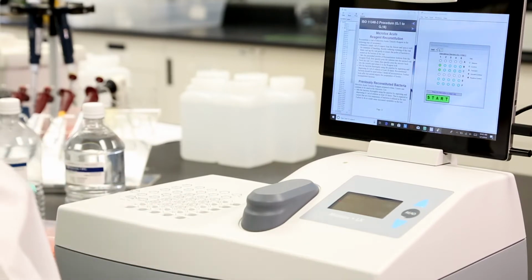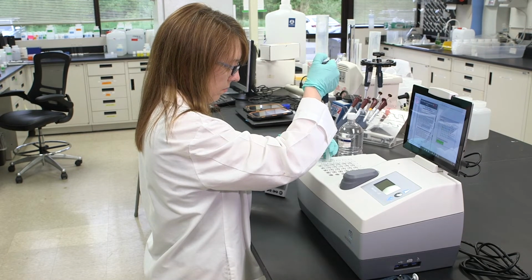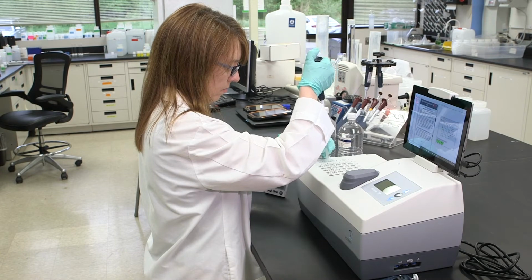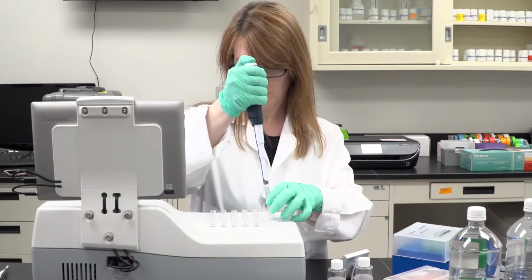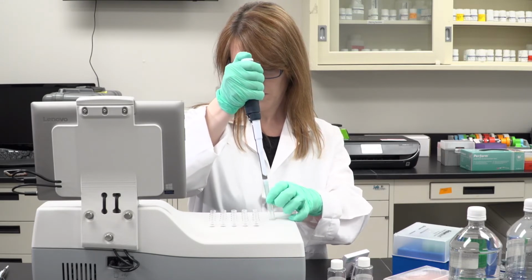the reagent well. Mix the bacteria thoroughly using the pipetter by aspirating and dispensing 0.5 milliliters of solution at least 10 times. Reconstituted bacteria should be used within 3 hours of reconstitution. Further tests after this period require the preparation of freshly reconstituted bacteria.